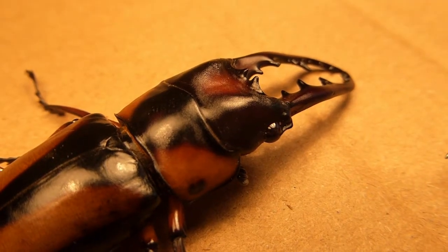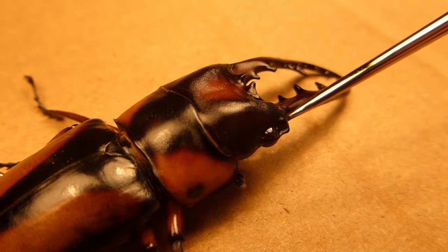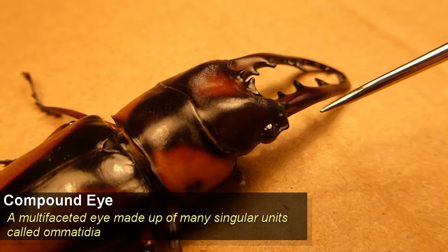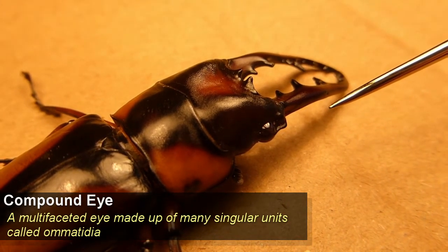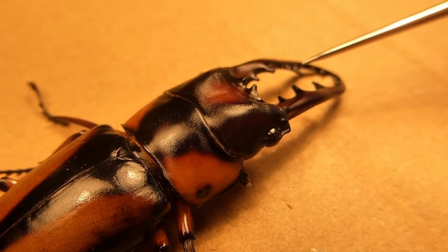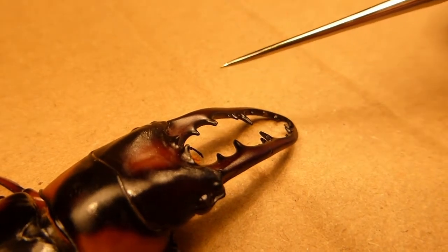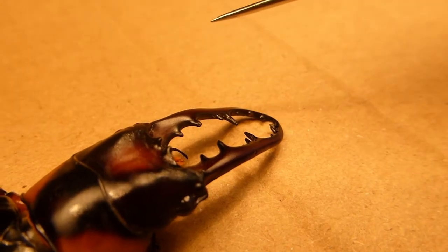Looking at the head of this beetle first, we can see a lovely view of the eyes here — these compound eyes, as I've mentioned in many of my other videos. Compound eyes are made up of units called ommatidia. You can also see a lovely view of these antlers here with the toothed insides. These will be used either for gripping objects the beetle needs to manipulate or, as I said, to spar with other male beetles to compete with them.